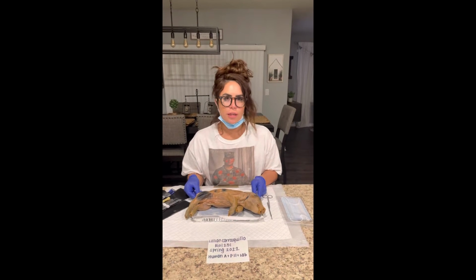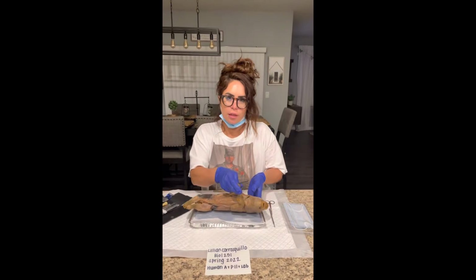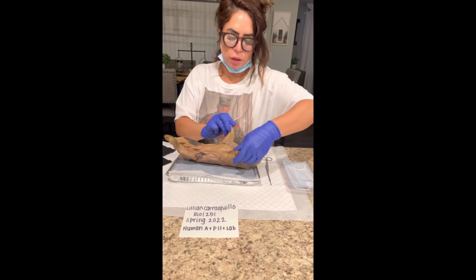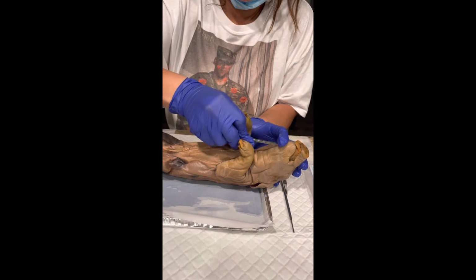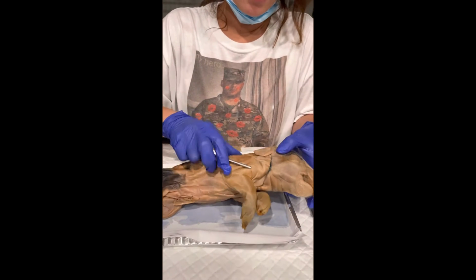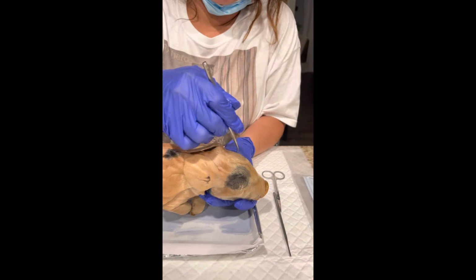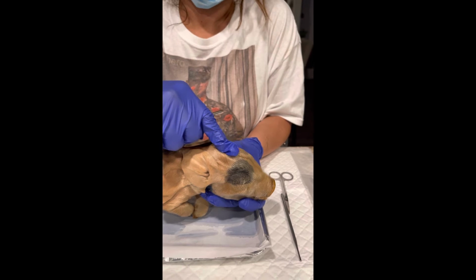Moving right along to the exterior side of our fetal pig, we're going to discuss the axial skeletal region, which is actually just the inner part of the fetal pig. It's just right down the center. We'll consider this the axial skeletal region. Next is the skull of the pig, the fetal pig, which would be right on top of its head. So this is the skull.